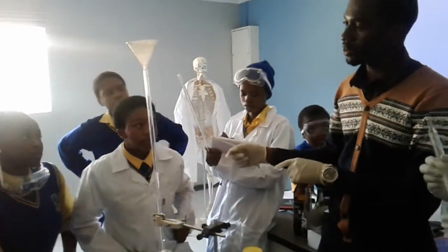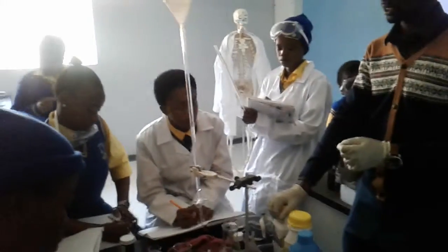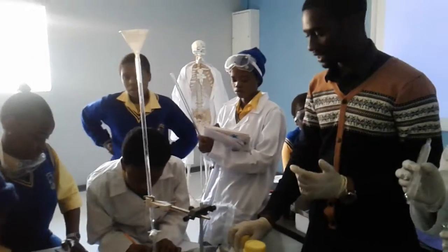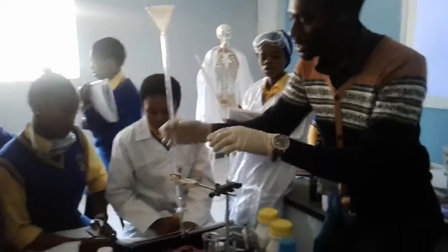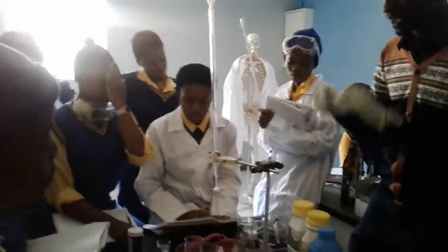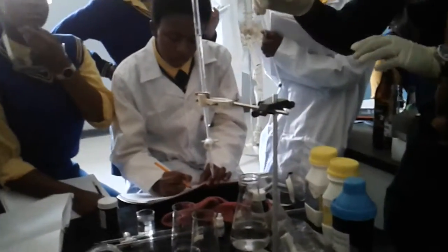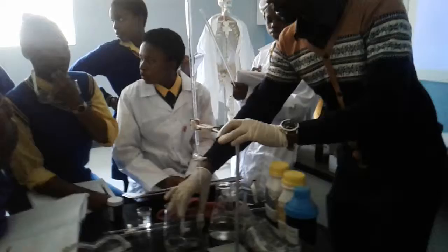Okay, good question. What's the SI unit? Everyone must remember. This is measured in cm3. What's cm3 called? Cubic centimeters. So you must convert it to decimeters. So it's measured in milliliters actually, and milliliters is the same as centimeters cubed. So you divide by 1,000 to get the decimeters. Those who can see, it's actually written centimeters cubed. 25. Okay. So now let me continue filling it.